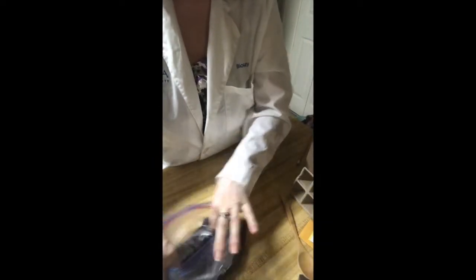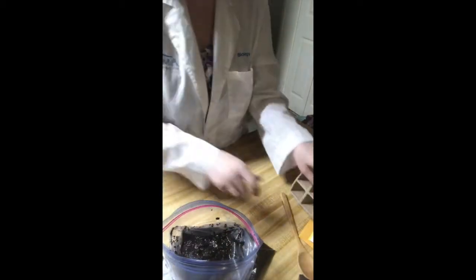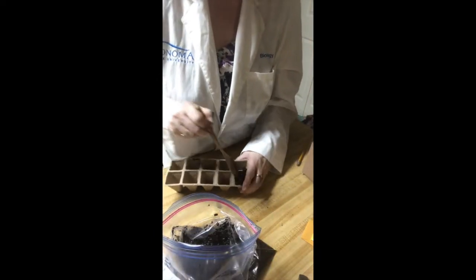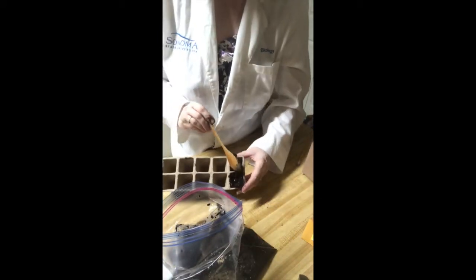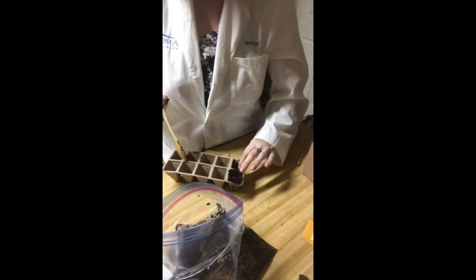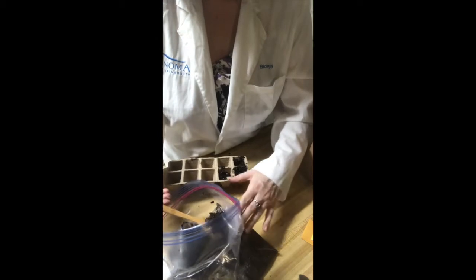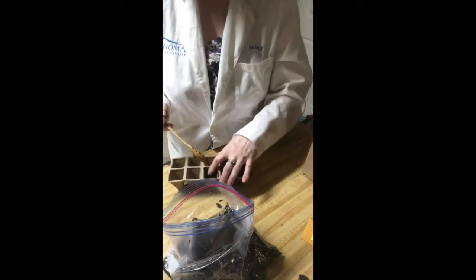Open up the bag so you're going to be able to get in there with the spoon, and let's grab our flat of pots. Now you're just going to scoop enough soil in to fill each of the cells to approximately the same height — ideally you want the same amount of soil in each little cell. I'm pressing down on it with my fingers, not trying to pack it in particularly tight, but I do want to make sure there aren't any air bubbles or any pockets. So put the soil in, tamp it down with your fingers, and go on to the next one. Go ahead and fill up all of the cells with soil.